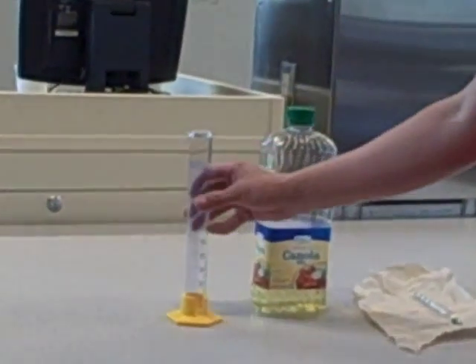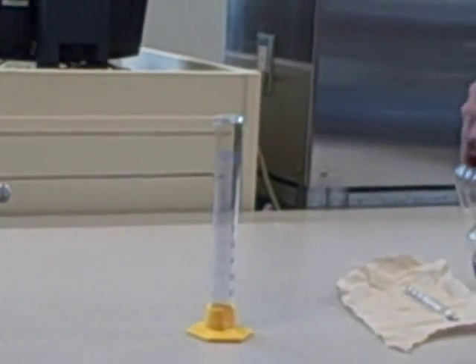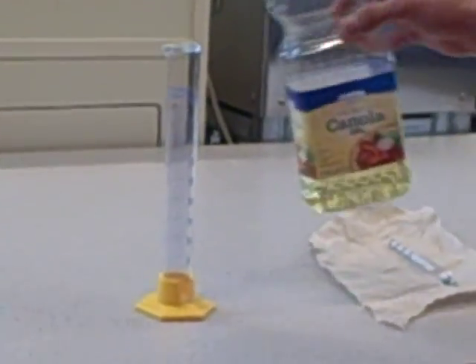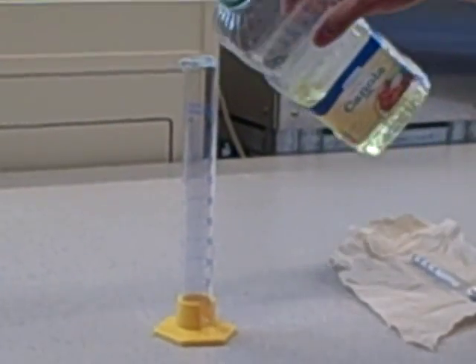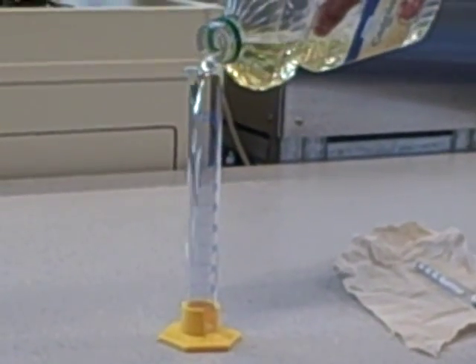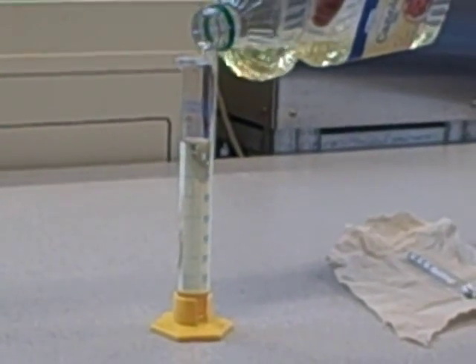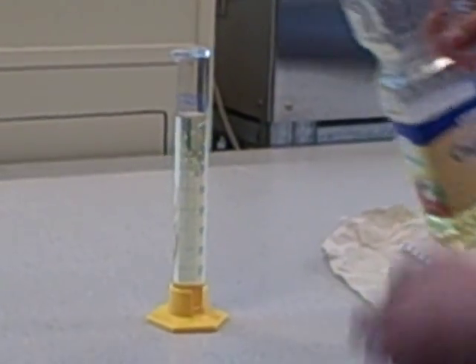You take a cylinder and pour your oil or cooking oil, like we're using, into it. Fill it about three quarters full so that when you put the hydrometer in, it won't overflow.